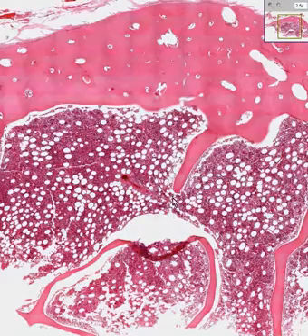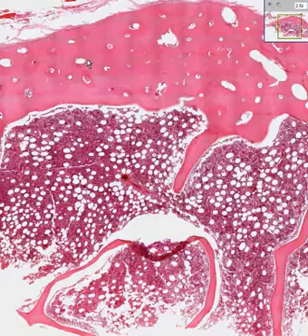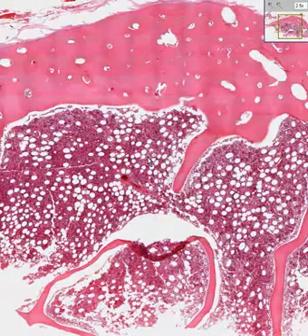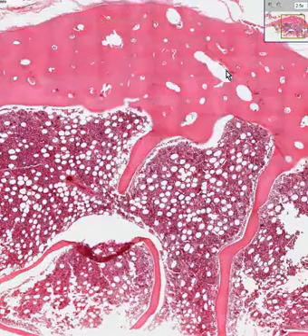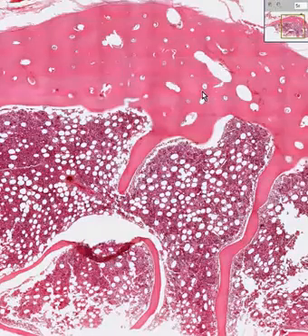Sometimes it's called spicular bone, and of course these little pink osseous structures themselves, which do not contain the features found in dense bone, in other words the Haversian canals, are called spicules. So cancellous bone is much simpler than dense bone.